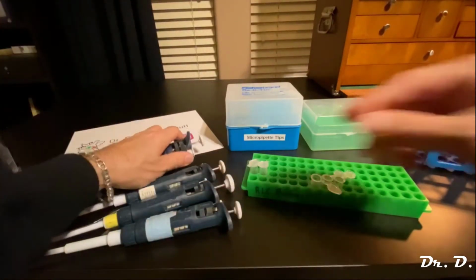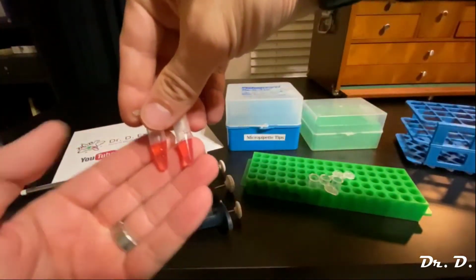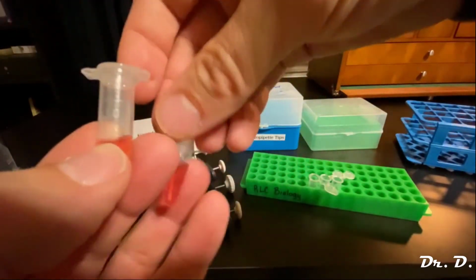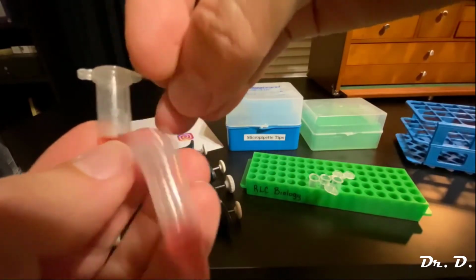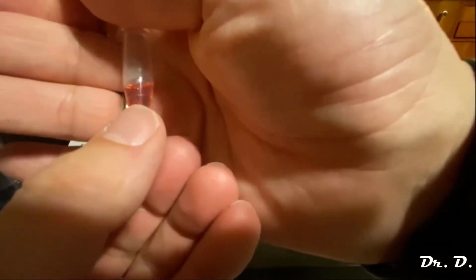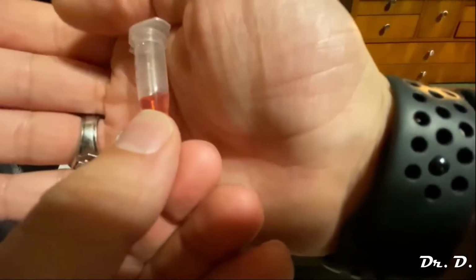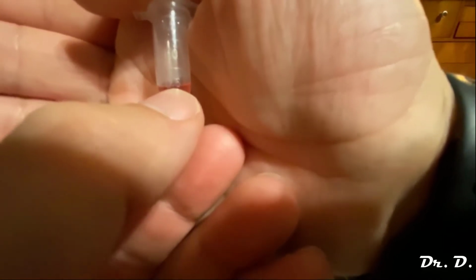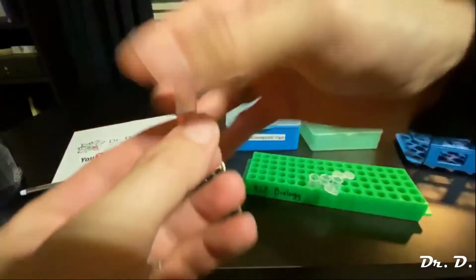That's really simple. Now look at this. Again, what do we have at this point? It even tells you. Sorry, it's kind of hard to see. Let me show you what I'm talking about. Oh, there goes that one. I know it's hard to see. Oh yeah, see that? 0.5 ml in this tube.